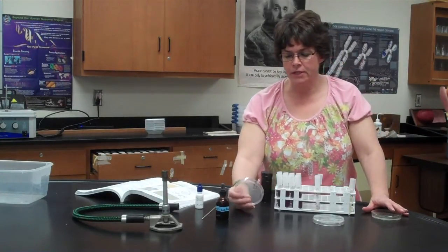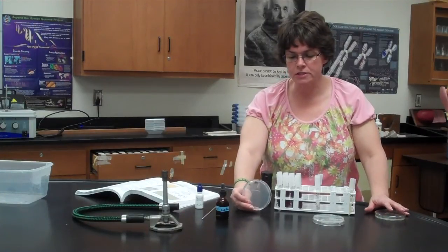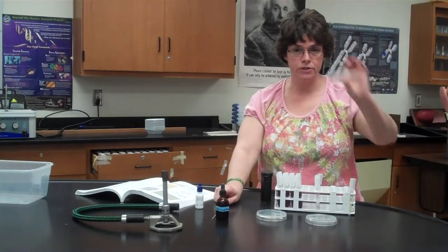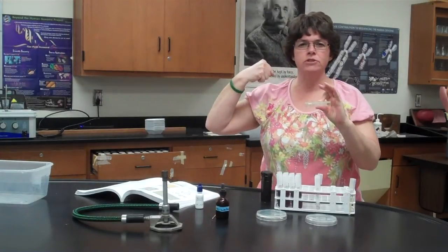The last procedure that you're gonna do is we're gonna be looking to see if there's any kind of spores or sexual reproduction that goes on with these yeast. So you have 2 plates of the glucose acetate agar, and it's kind of a spore enhancing agar. Because we have 4 species in 2 plates, you're gonna divide each plate in half and write the name of the species on either side of the plate. And then you're going to take a loop full of the yeast from the original plate. In this case, get a little bit more. Once again, don't gouge into the agar, and you don't need the whole plate. A couple of colonies is fine.